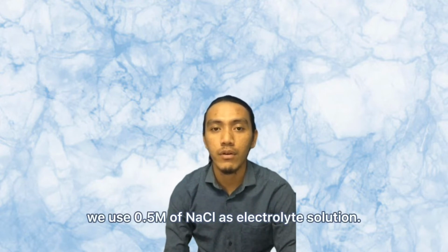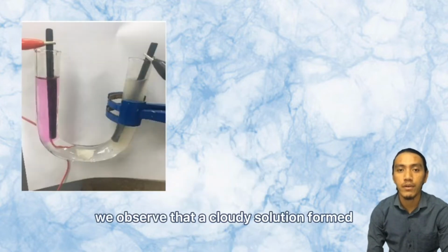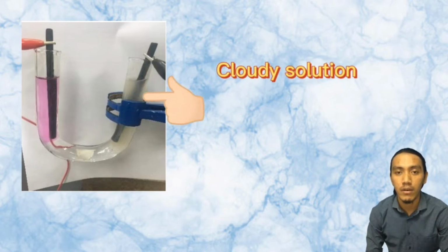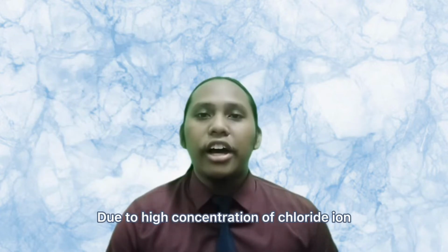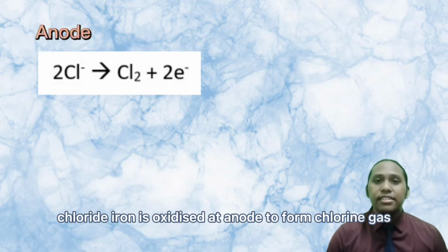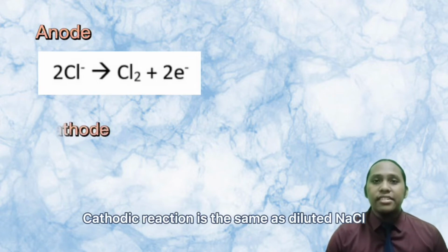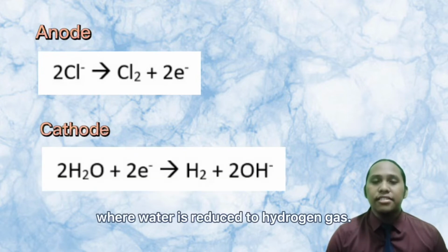In addition, we use 0.5 molar of sodium chloride as electrolyte solution. In this case, we observe that a cloudy solution formed at the anode electrode. Then, blue litmus paper turned white in color. Due to the high concentration of chloride ion in the solution, chloride ion is oxidized at the anode to form chlorine gas that is visible as cloudy solution. The cathodic reaction is the same as in diluted sodium chloride, where water is reduced to hydrogen gas.